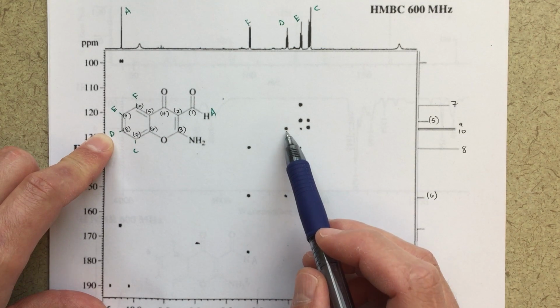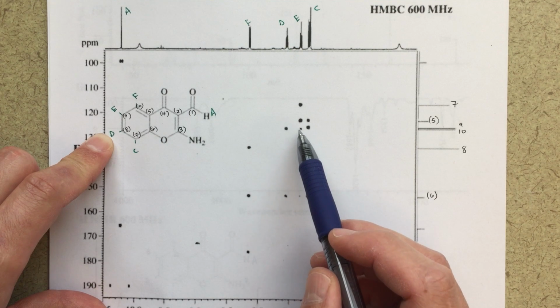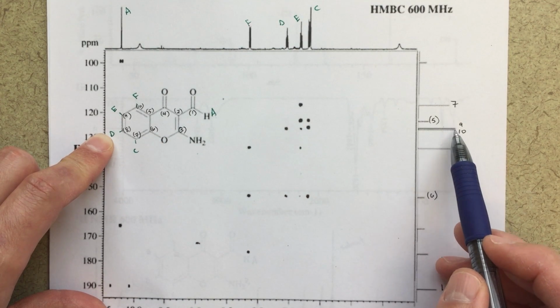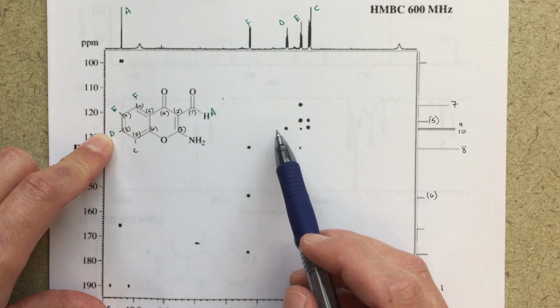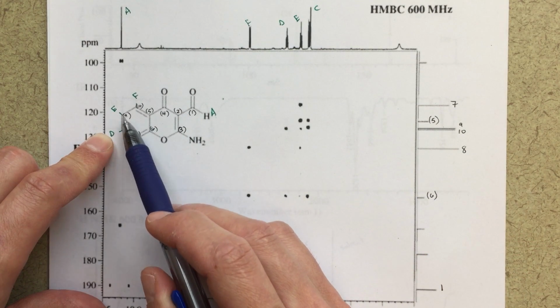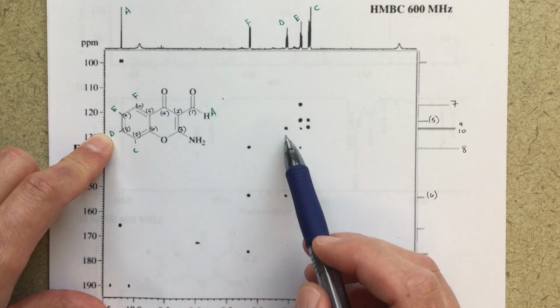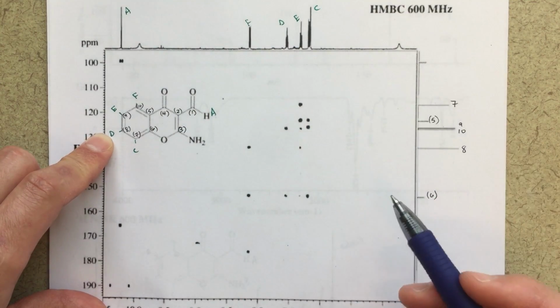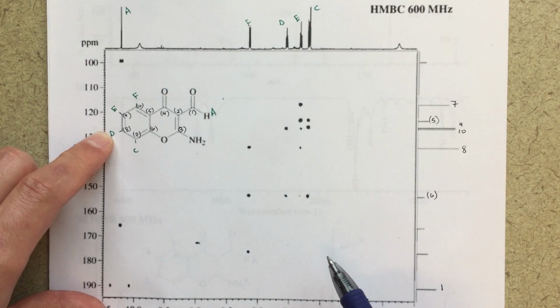And this peak here, that correlates with 10. It does look like it's a little bit below these other peaks. So these 2 peaks actually look below this peak here. So that would be correlating with 10. 9 and 10 are really close together here, but I would say that would be my 1, 2, 3 bond correlation, D to 10. So that looks good. No new information, just sort of confirming or reiterating some information.